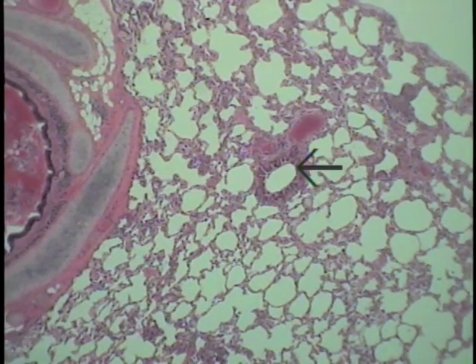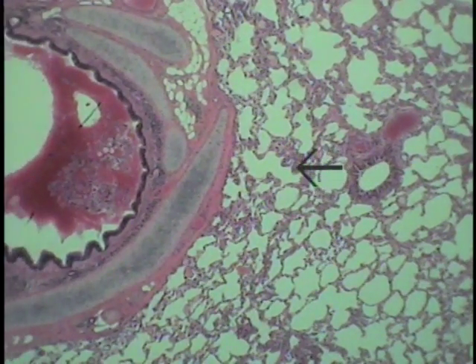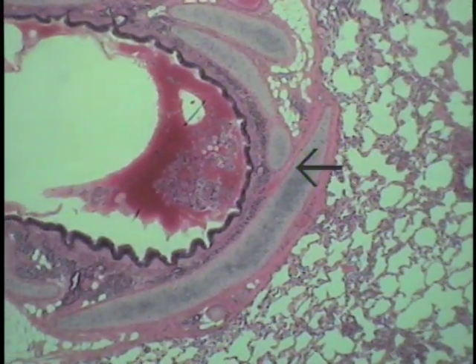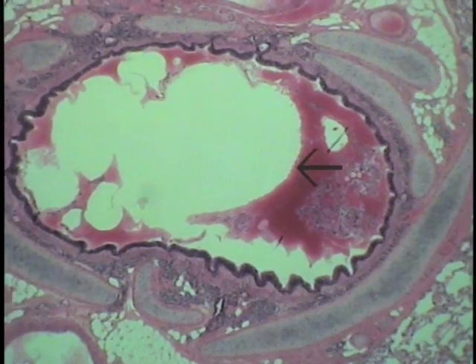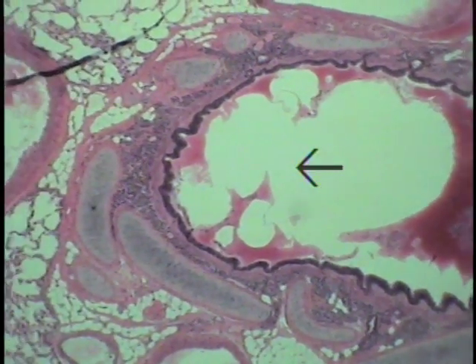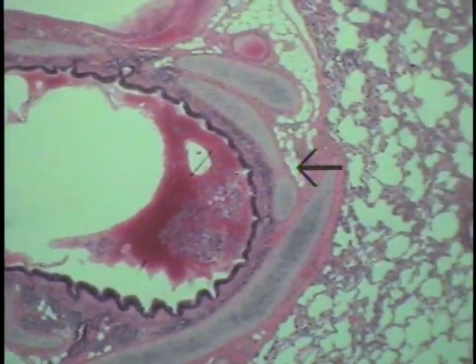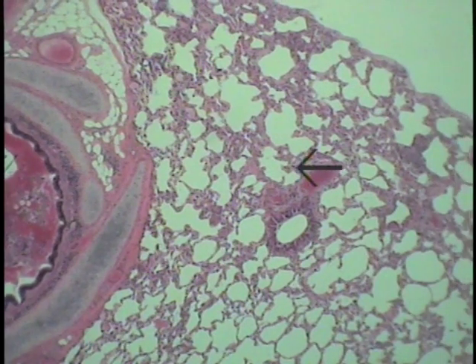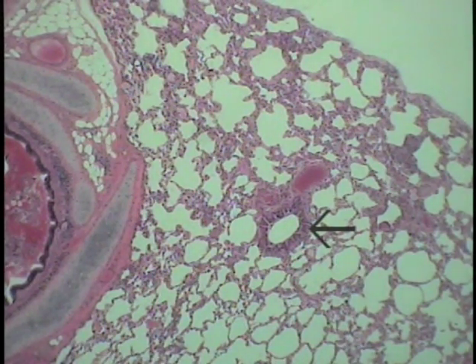And in comparison, if we look at a primary bronchus, one of the major subdivisions of that conducting portion of the respiratory tree, this was the section of an intrapulmonary bronchus examined earlier, a primary. A very large structure with that cartilaginous support. And once we compare it now to that important structure, the bronchiole, use the scanning objective to find such bronchioles and then examine each of these at increased magnification.